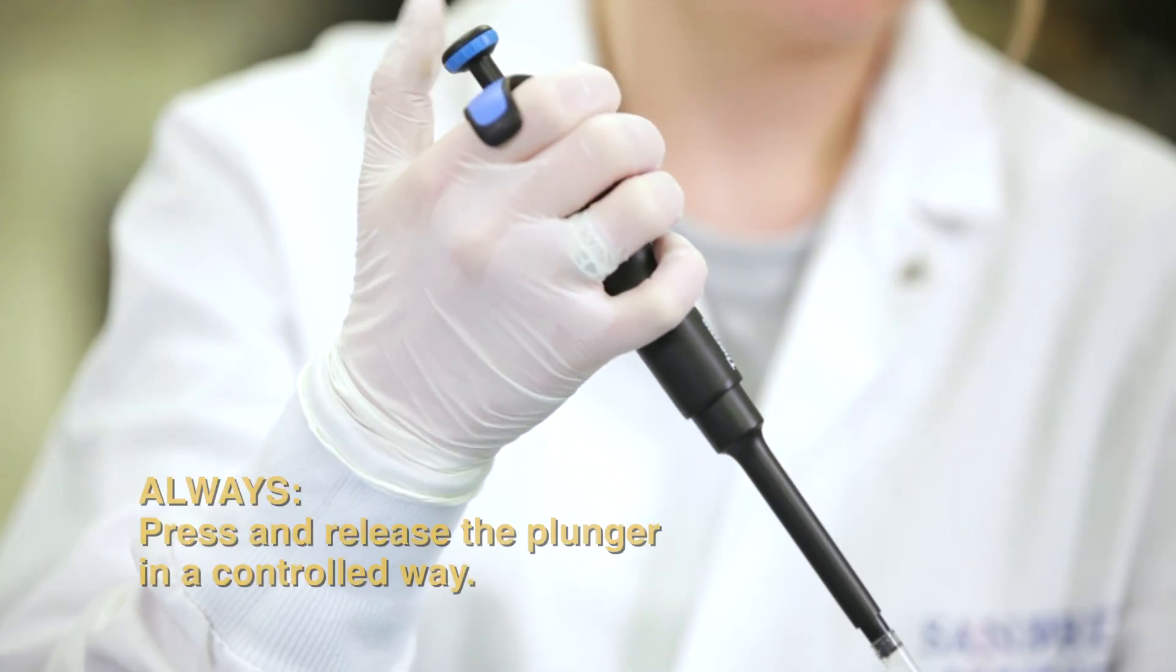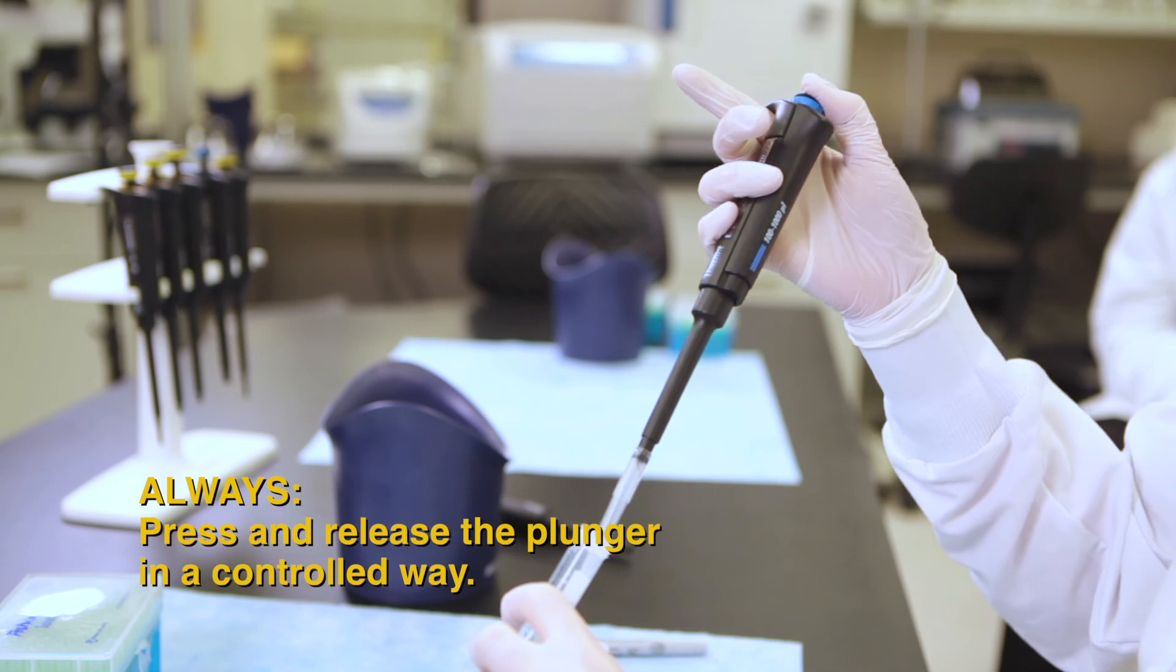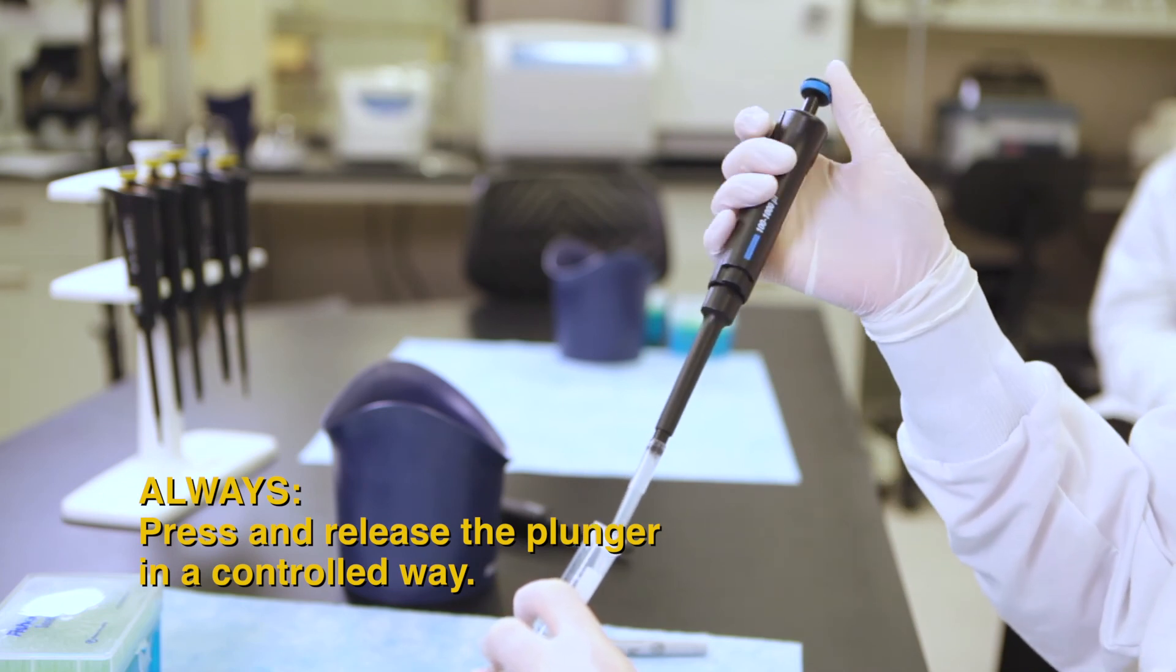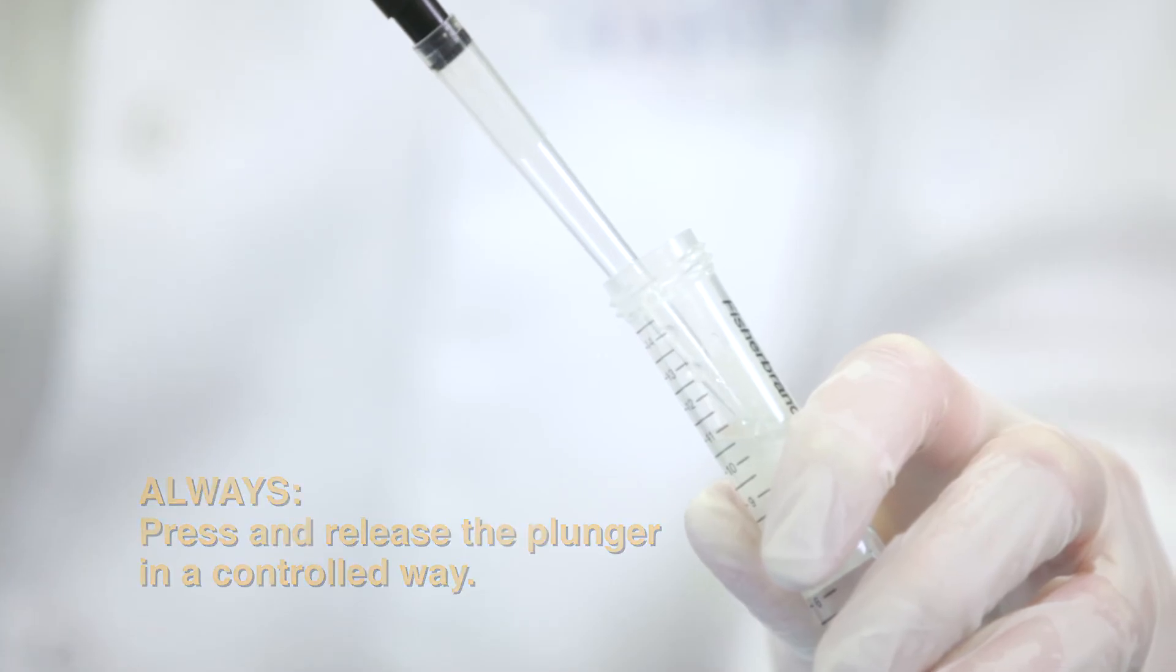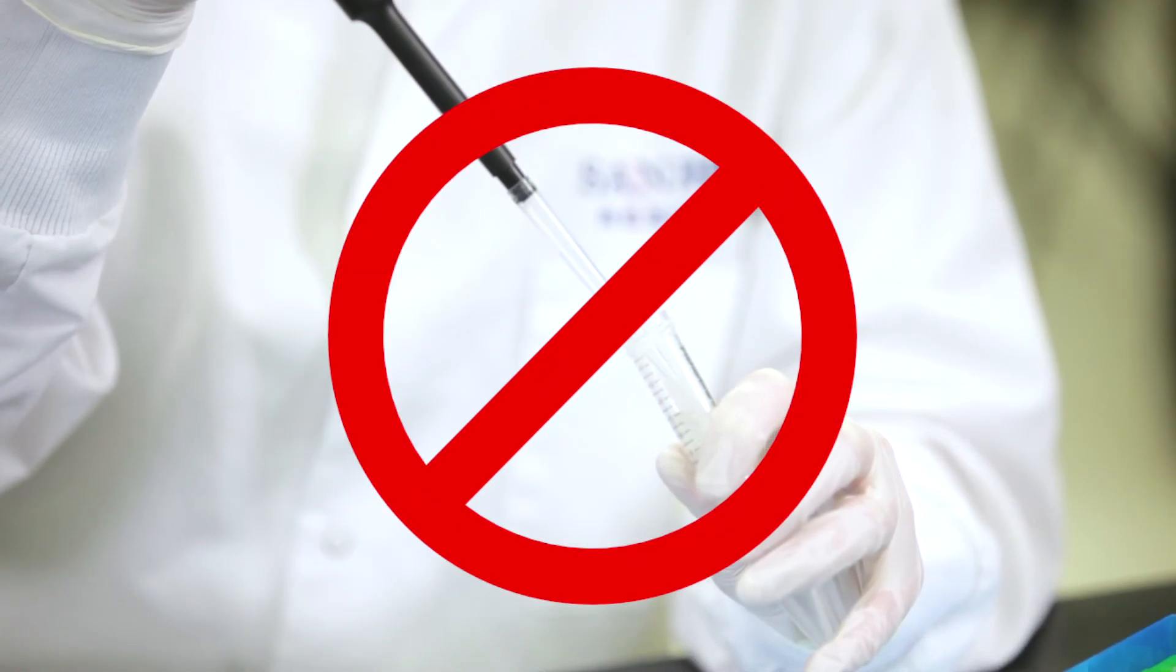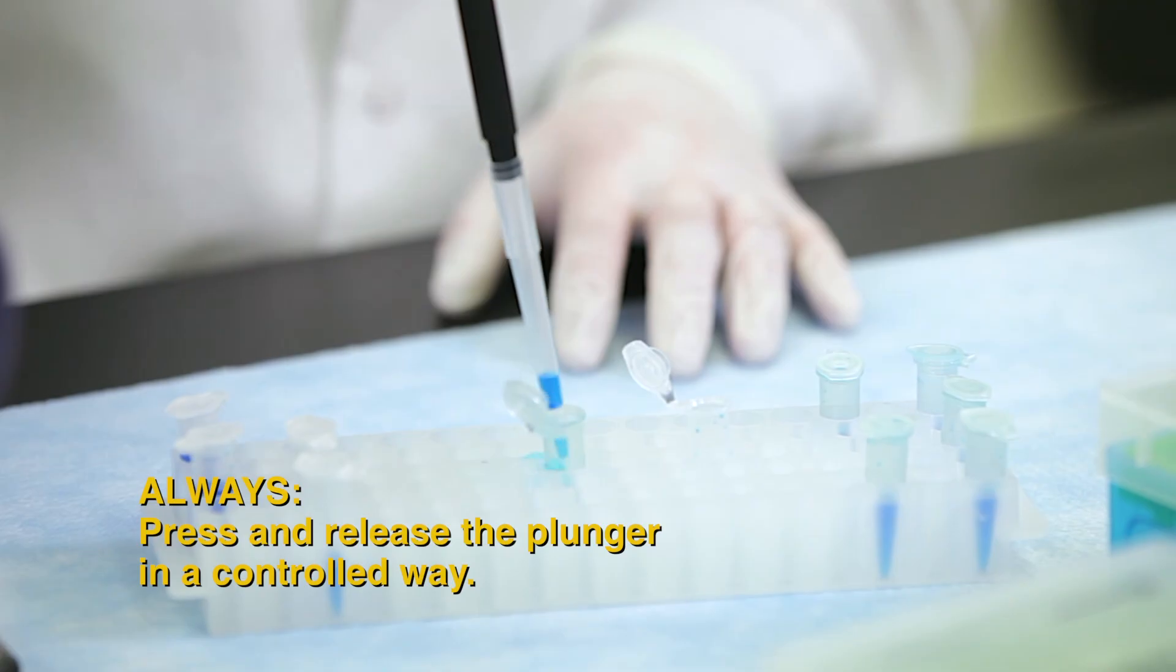When taking up liquids, do not simply let go of the push button. The liquid may be sprayed around the inside walls of the tip and up into the pipette body. This can cause inaccurate volume dispensing and pipette contamination. Release the push button in a controlled way. Do not slam the plunger down to move the liquid to a new container. This will spray out too strong.